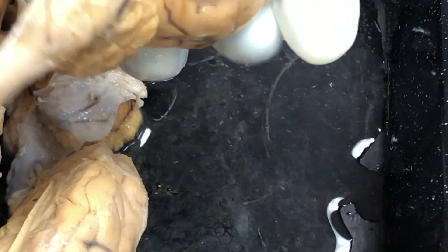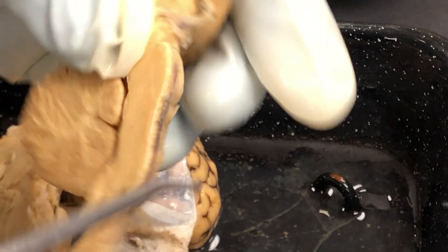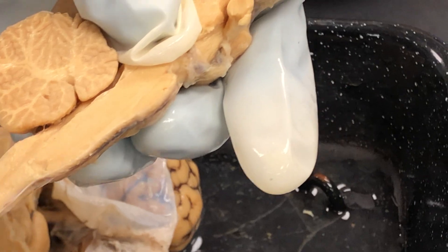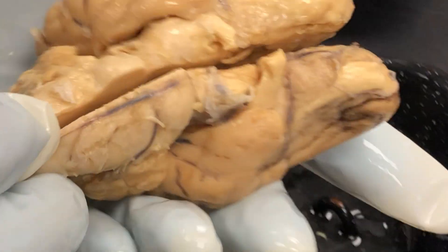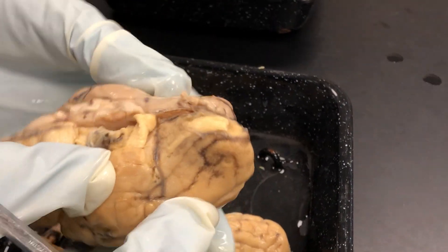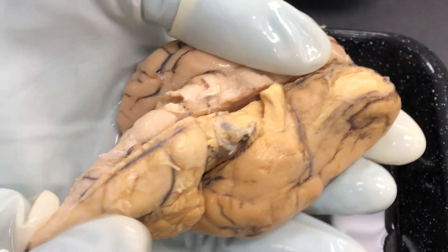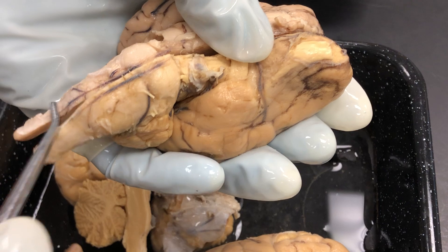On the ventral view we also have the pons, the medulla oblongata, and the spinal cord. The medulla oblongata is here — it's just posterior to the pons in the sheep brain. Once it tapers and narrows down past the cerebellum, it runs into the spinal cord. Here's your pons — a little bulge. Here's your medulla oblongata, right posterior to it. And then you have your spinal cord right here where I've got my fingers.